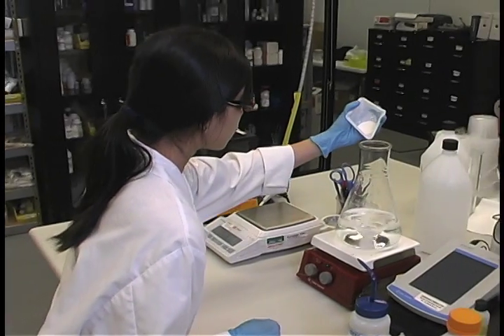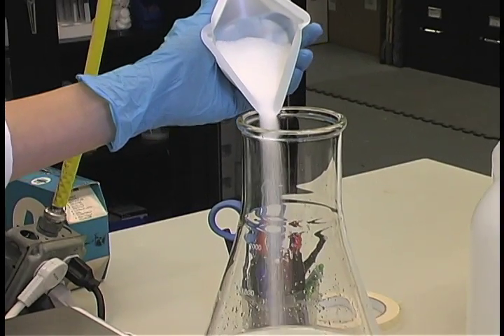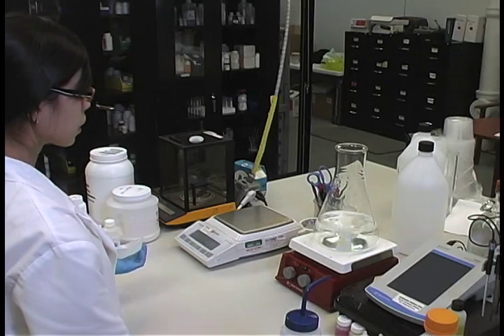Slowly begin adding the dry components to the medium being made. Stir each component to the medium until dissolved.